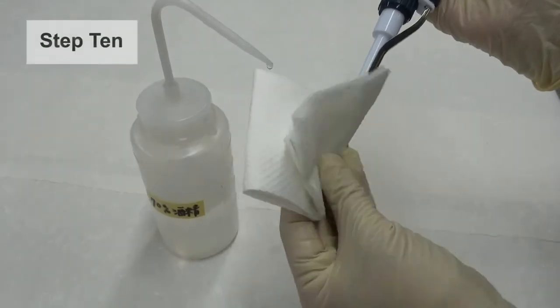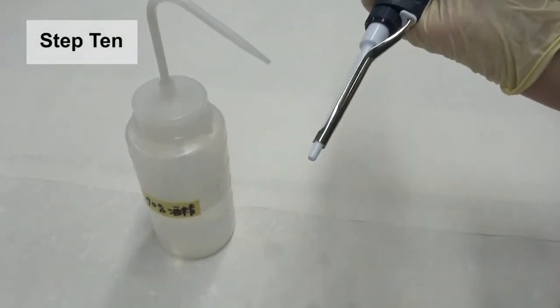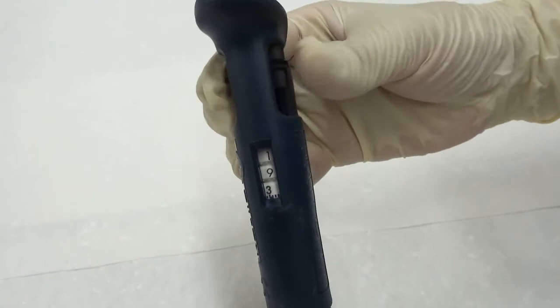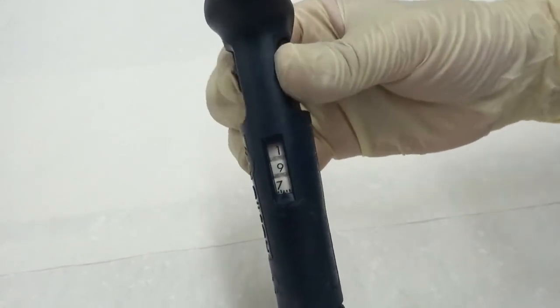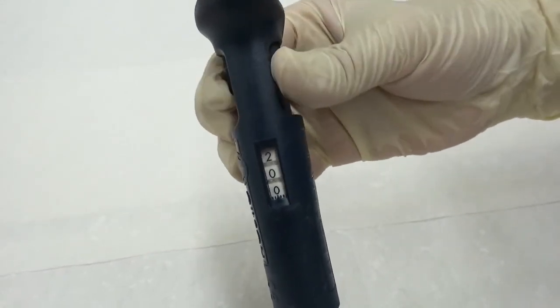Step 10. Clean the pipet immediately after use. Set the volume adjustment dial to its upper limit. This shall protect the internal parts from elastic fatigue.